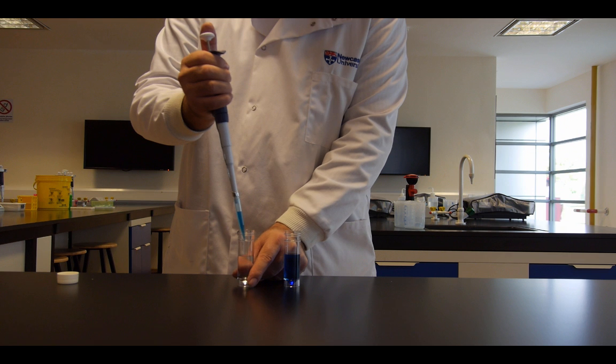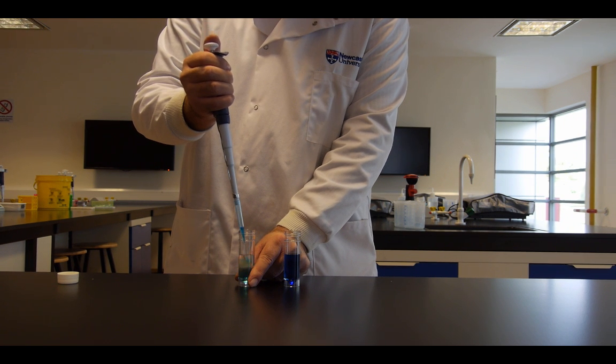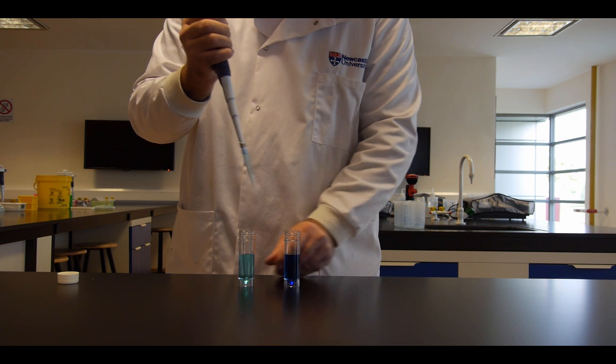Move over to the other container, push down to the first stop, pause and then push all the way through as far as you can.